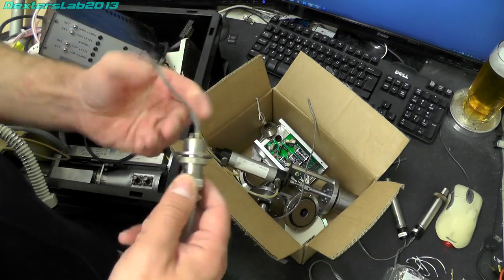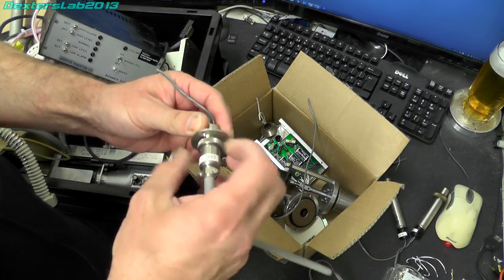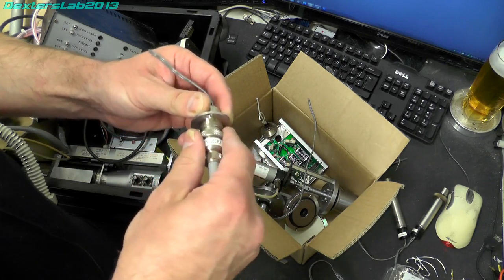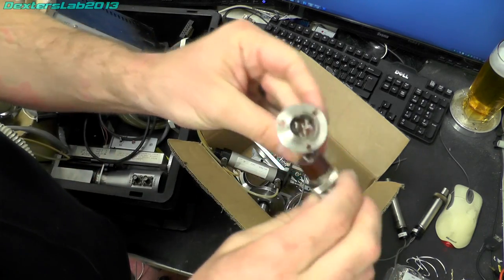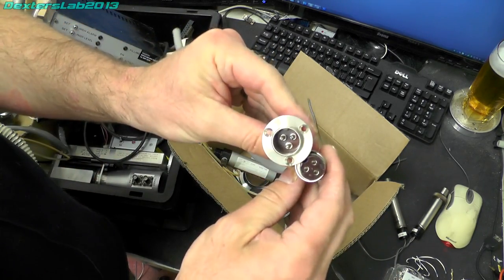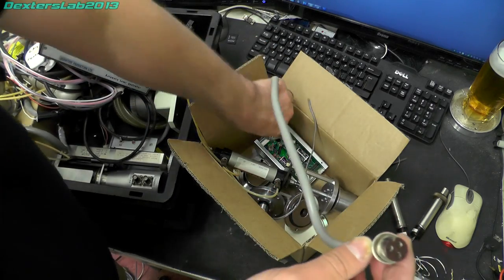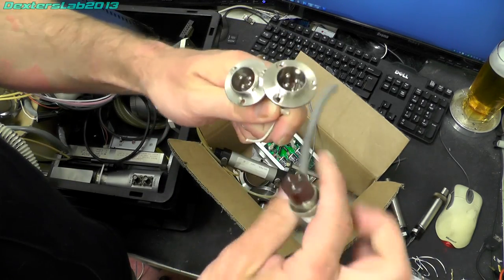We've got a couple of connectors that somebody mentioned they needed because they're no longer manufactured. I think there's another one, yeah. So there's a couple of those, so those will be going off to a new owner.